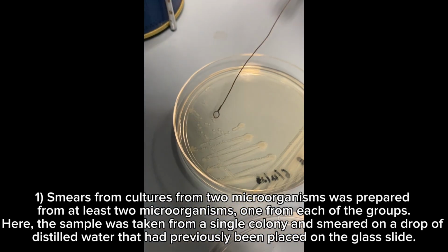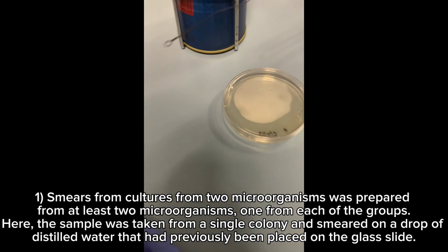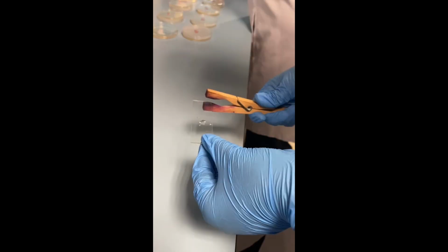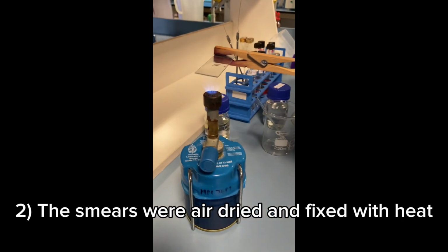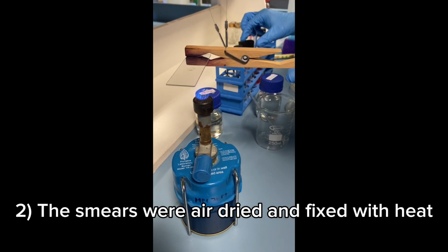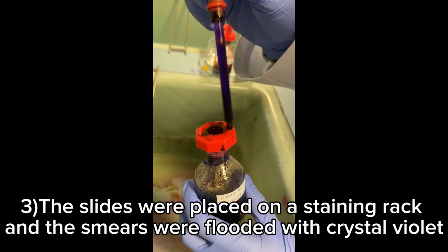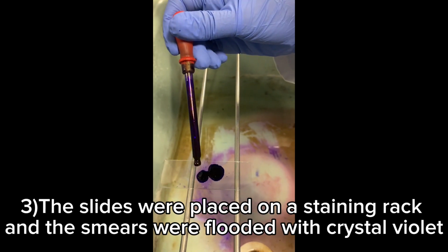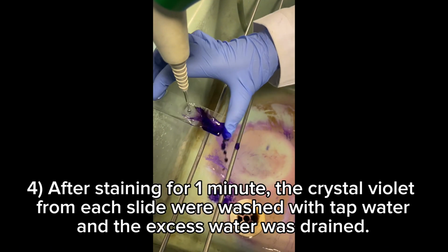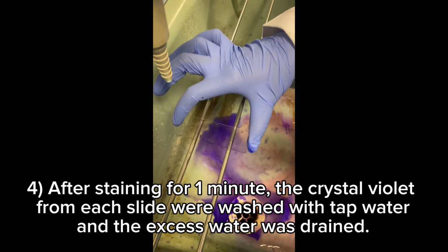Single colony. I feel like it's not okay. You guys can add another one, ya?